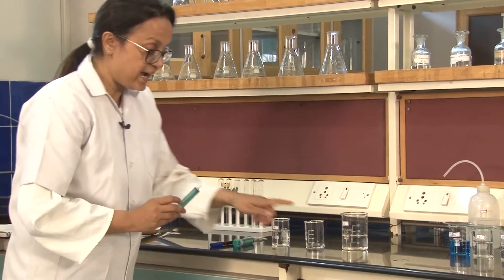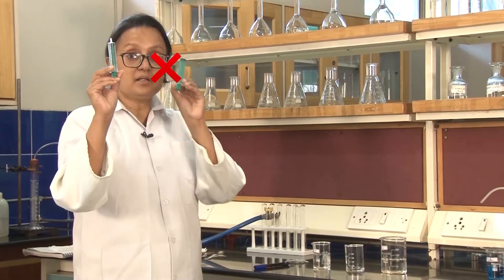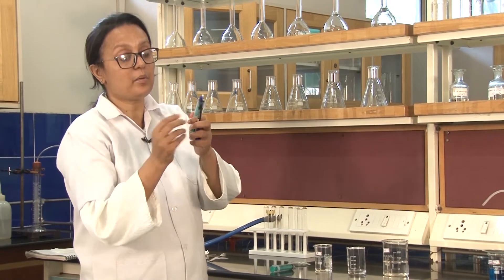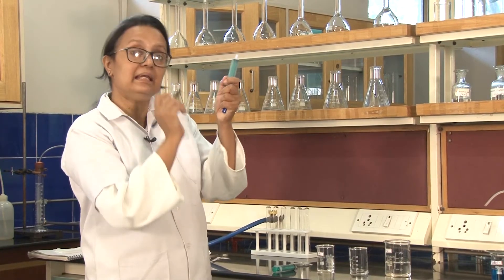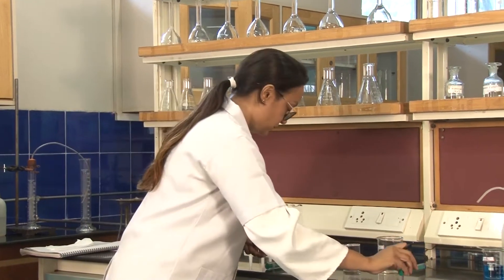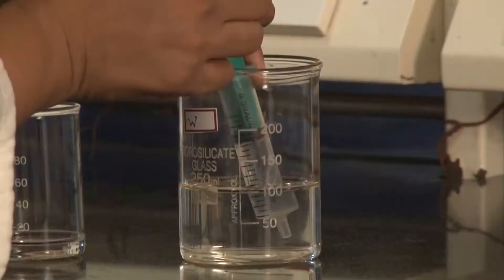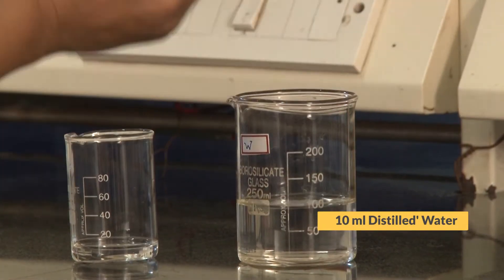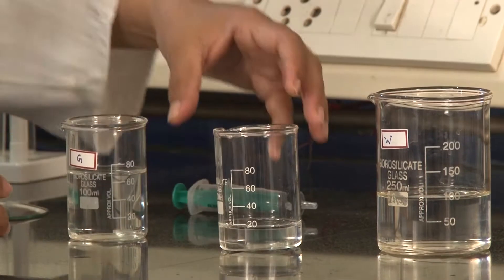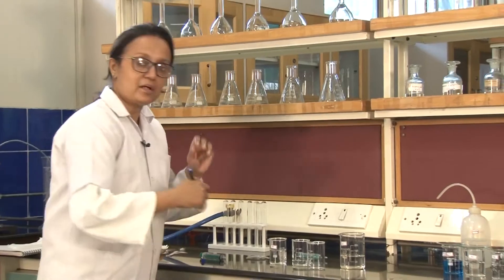To add distilled water, we use a separate syringe — do not use the same syringe for distilled water. We use a CD marker to label it: W for the syringe used only for water, and G for the glucose sample syringe. With the W syringe, we measure 10 ml of distilled water and add it to the beaker. This is our first serial dilution — if glucose G was 4%, this becomes 2% glucose.